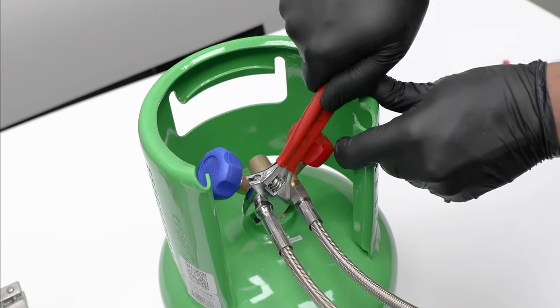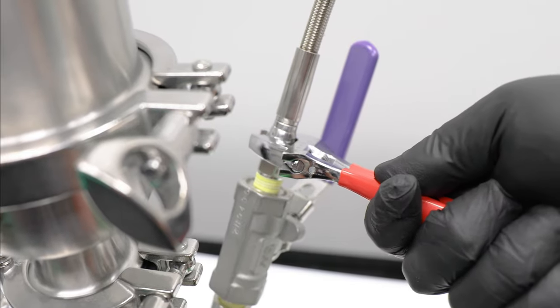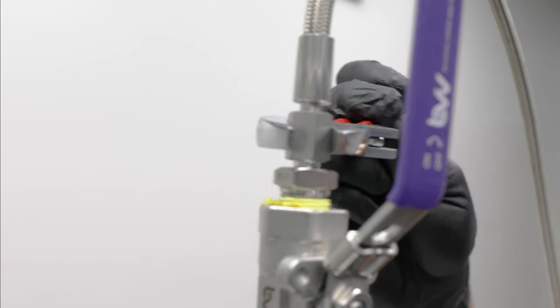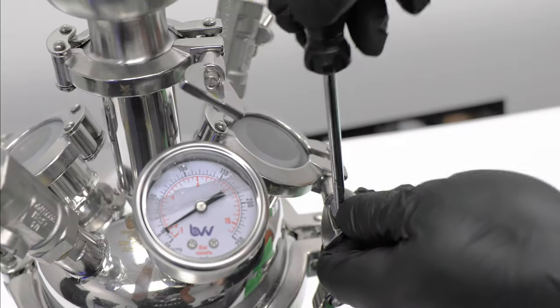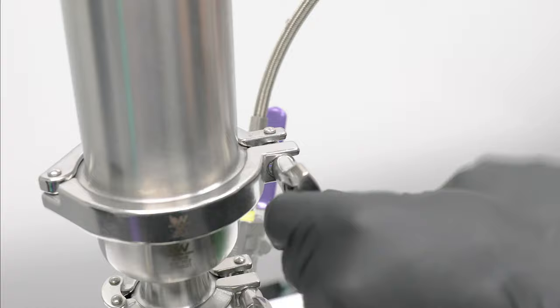Using a wrench, tighten down all ends of all hoses. Use that wrench to tighten down clamps, or a screwdriver if you have an eyelet hole like these.